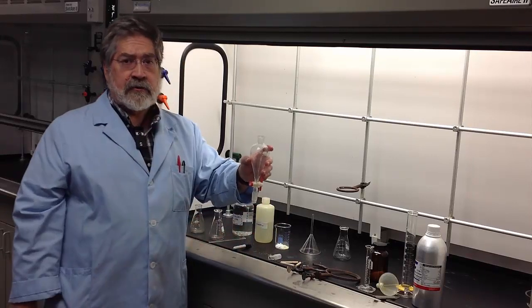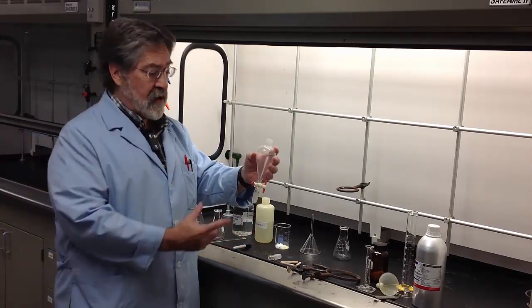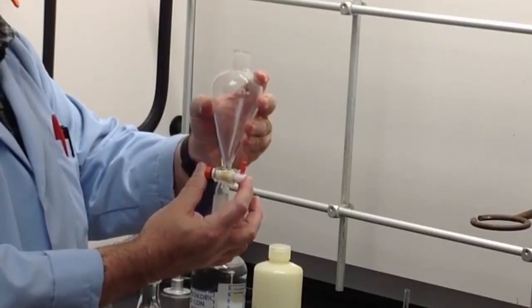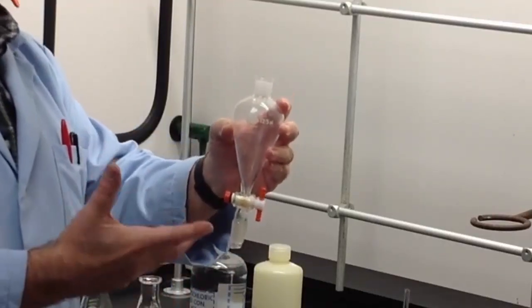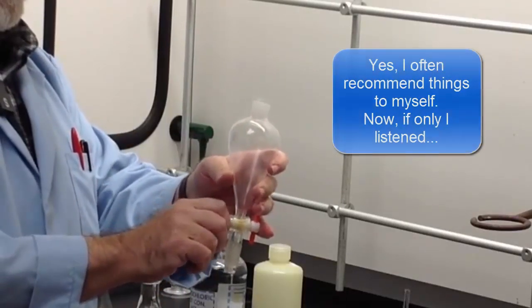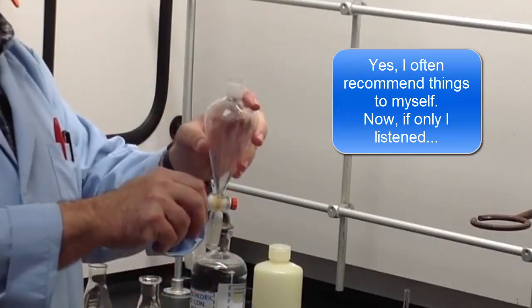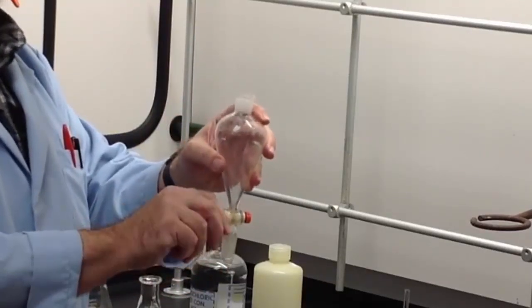When you get the separatory funnel, check it and make sure a couple of things are a good match. First of all, check the stopcock. Now, in this particular case, you see that this one is free to move. That's a source of leaks when using the separatory funnel. So if I had this one, I would recommend tightening up the nut, and that will take care of the problem of the stopcock moving back and forth in the glass. But make sure you don't tighten it so much that you cannot turn it freely.